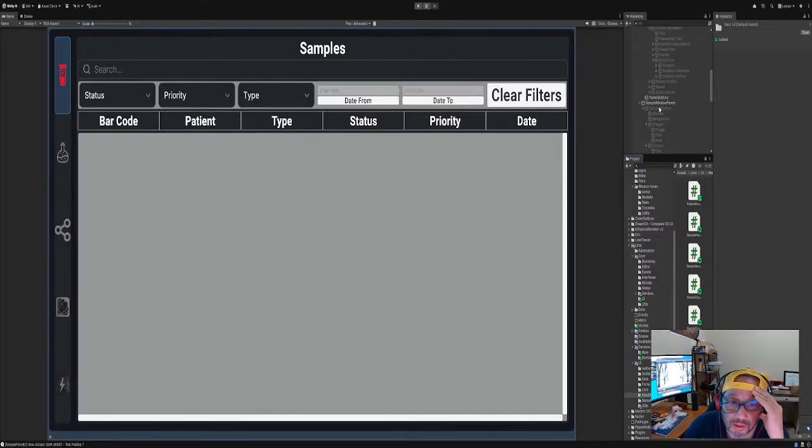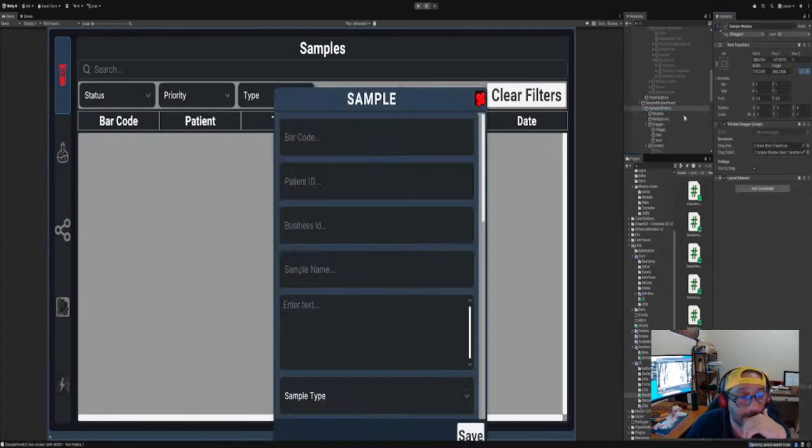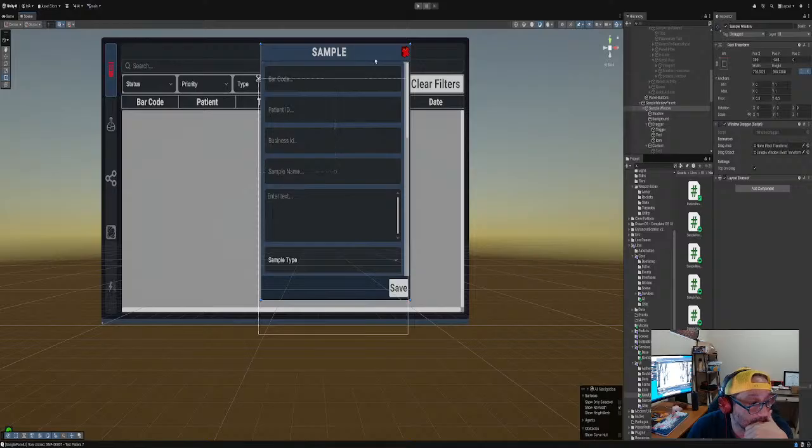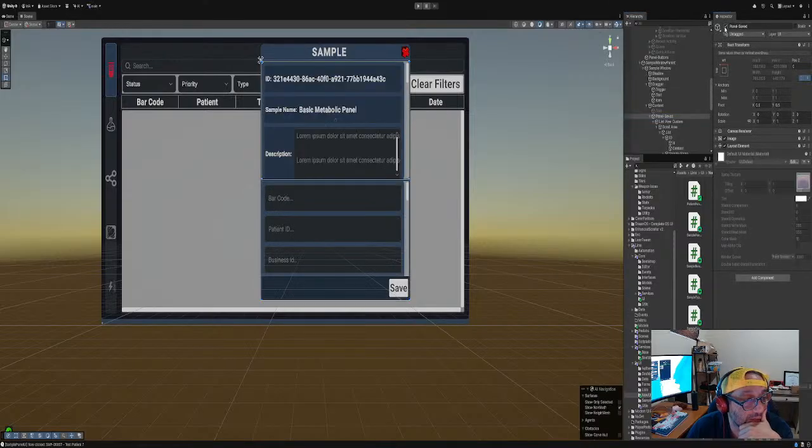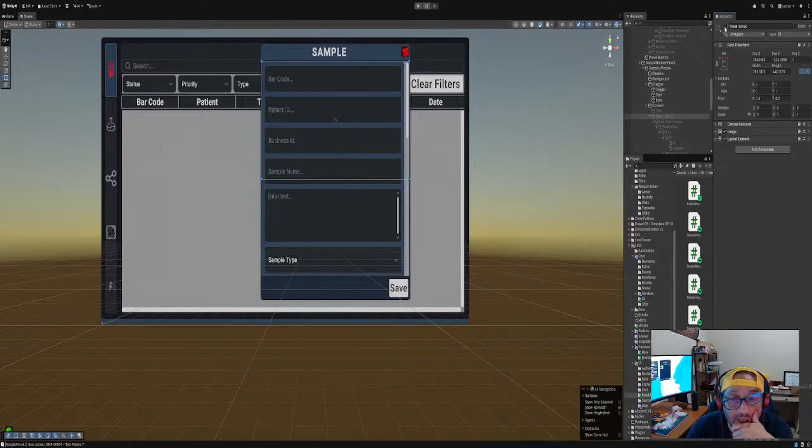All right. So then we have this. Just take a look at it. We can either save it. It's already in edit mode, right? So let me see this. They have other panels here. We have the save panel. Where is it? Save panel. Turn that on. Okay, that's saved, right? See, we could turn this off.